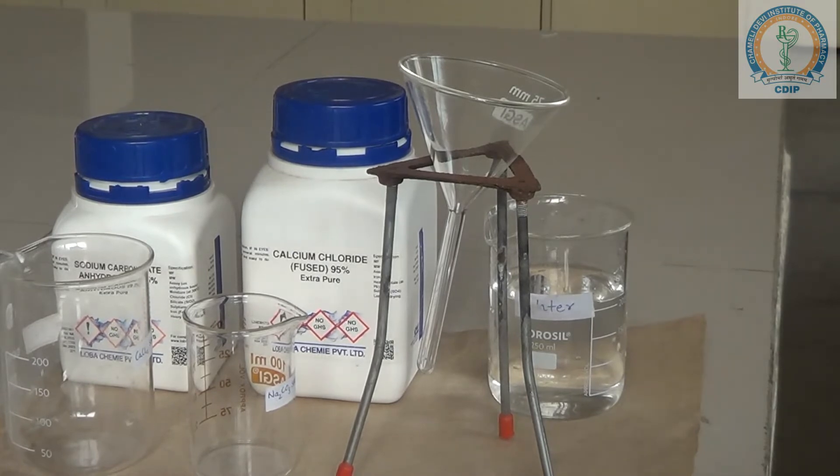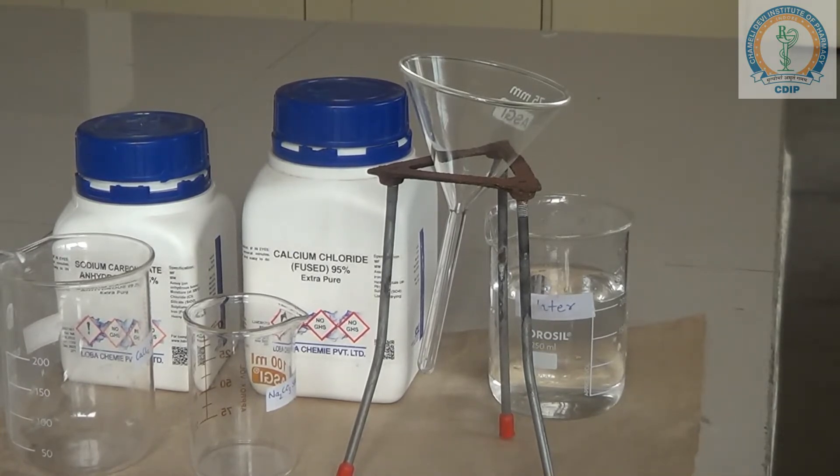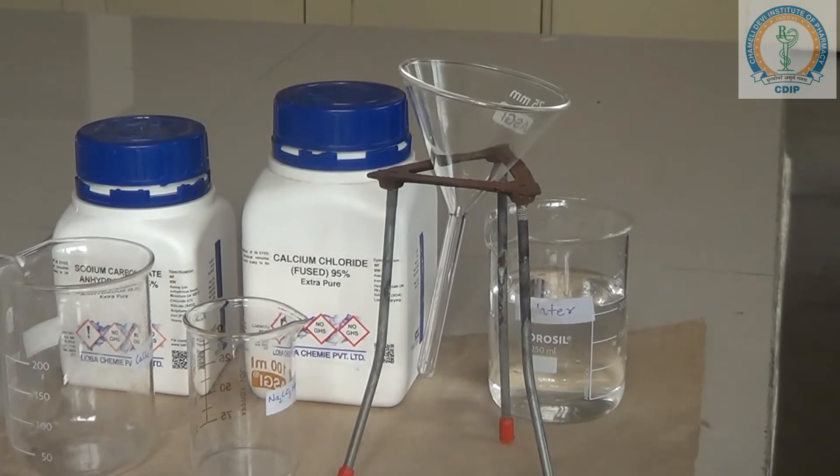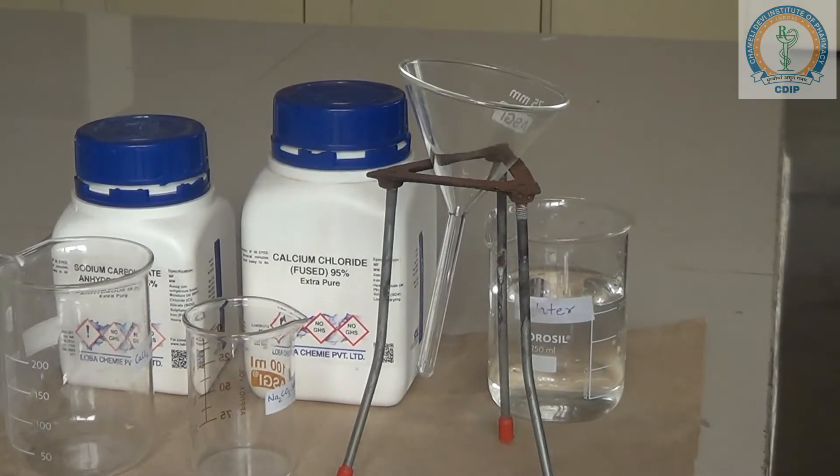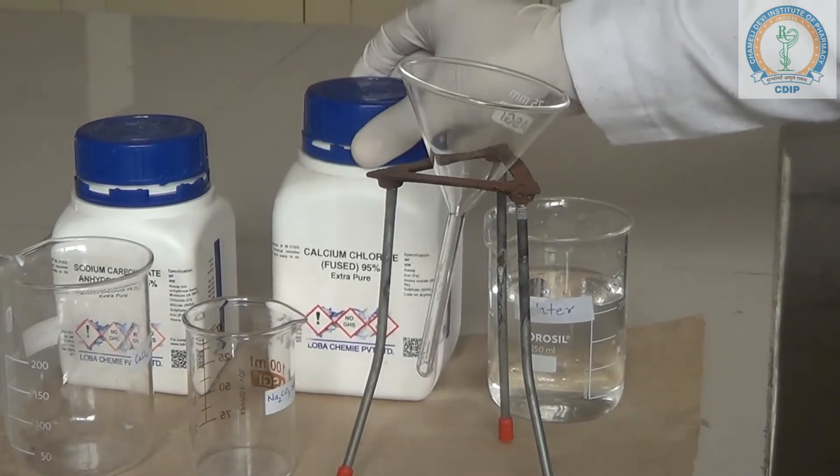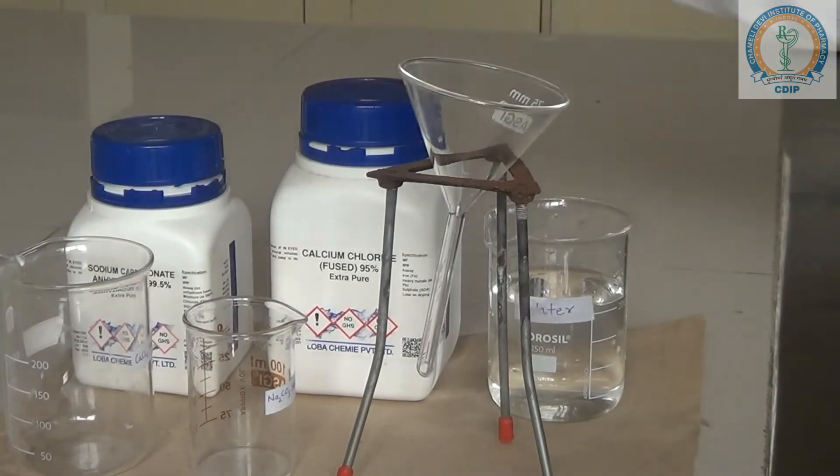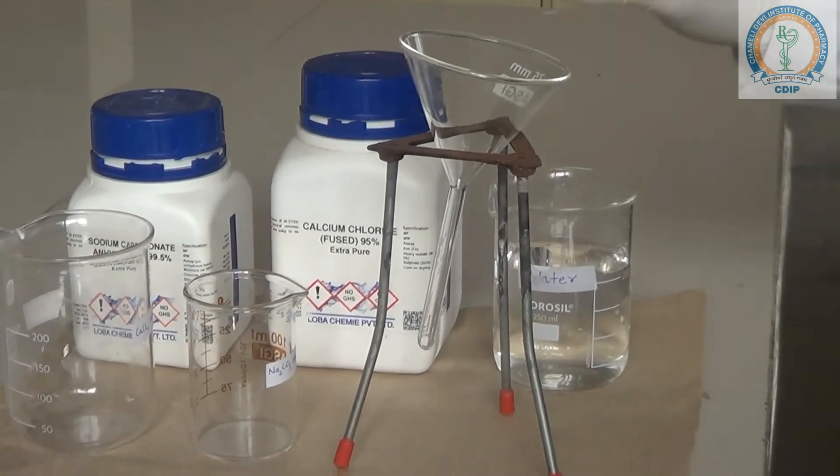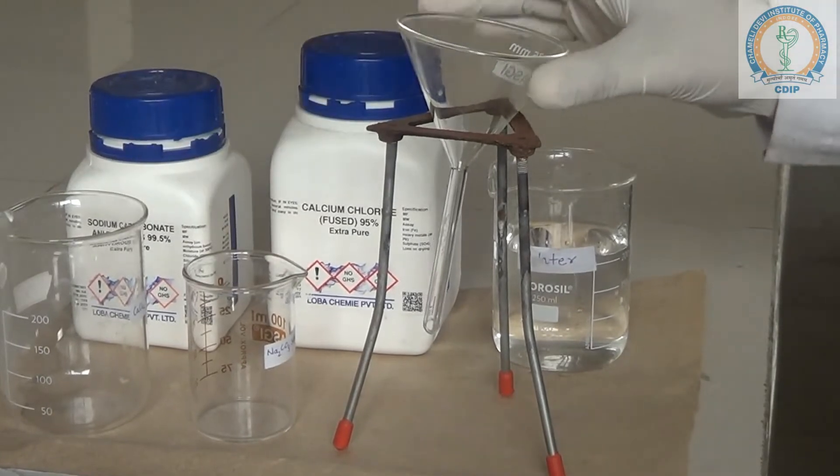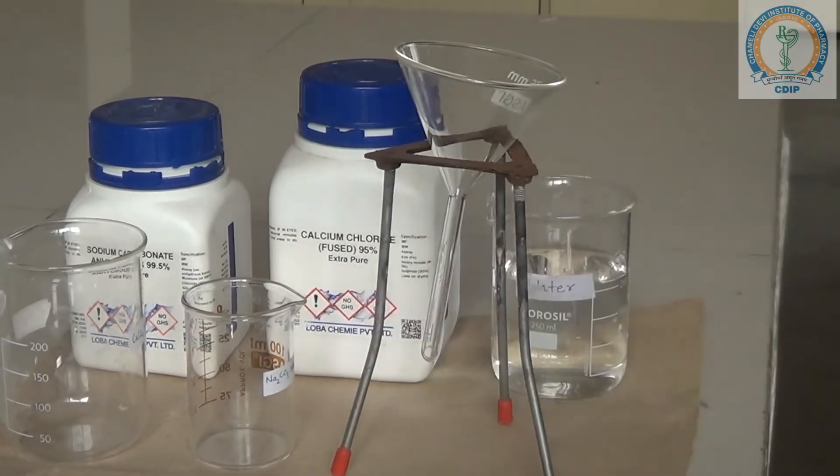Guys, today we are going to prepare calcium carbonate. For the preparation of calcium carbonate, we require calcium chloride, sodium carbonate, distilled water, and the glassware required: beakers, funnel, tripod stand, and filter paper.